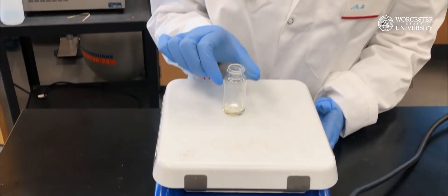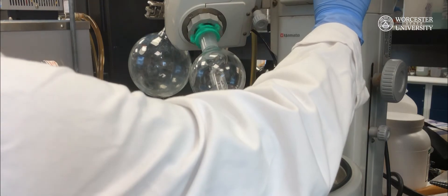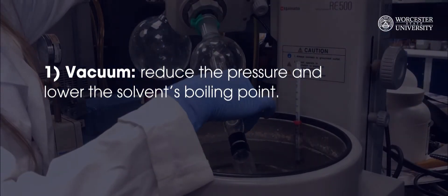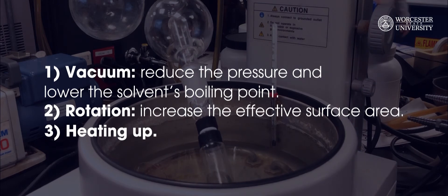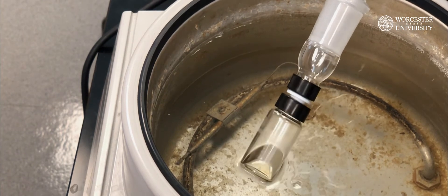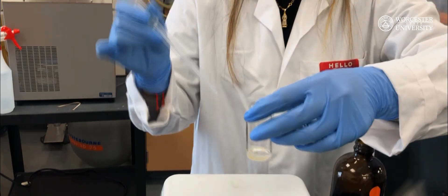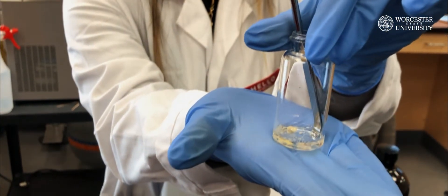Next, we will remove the solvent ethyl acetate, either by heating or rotary evaporation. Rotary evaporation increases the rate of evaporation by being placed under a vacuum, which reduces the pressure and lowers the solvent boiling point, rotating the sample to increase the effective surface area, and heating the solution using a water bath. After ethyl acetate is evaporated, the mixture slowly becomes oily. TBME, or methyl tert-butyl ether, is added to help solidify the product. Collect the product with vacuum filtration. Confirm the obtained product using IR and melting point.